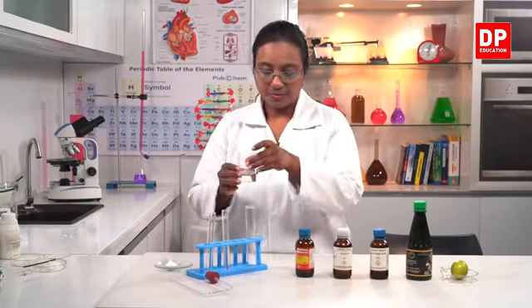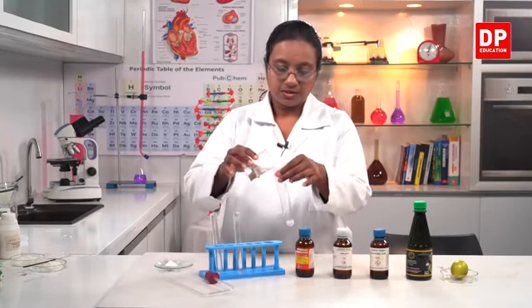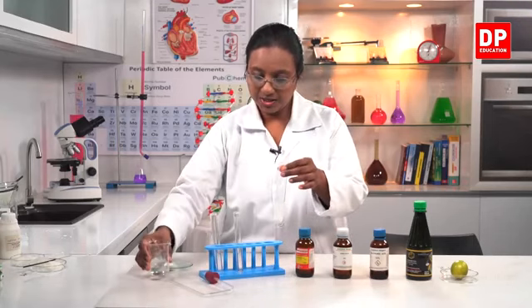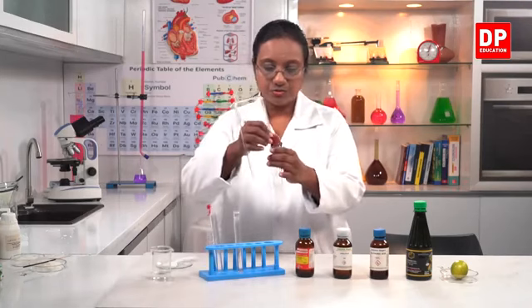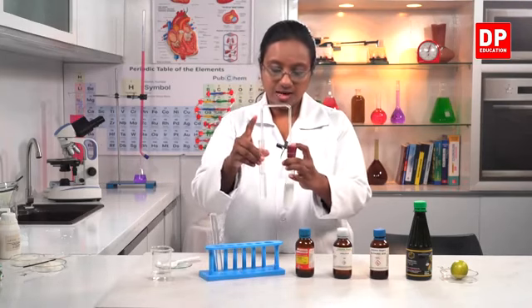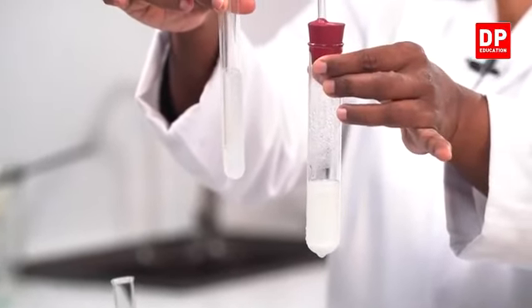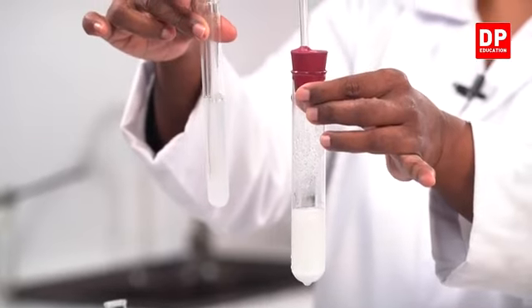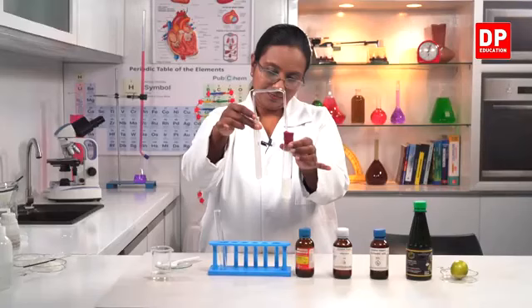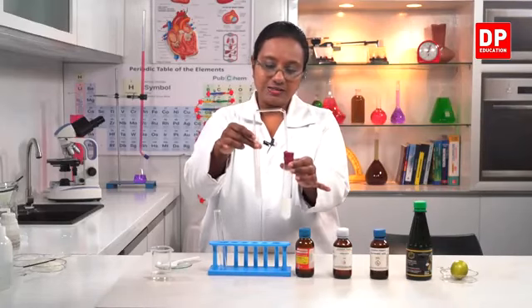To that, I am going to add dilute hydrochloric acid. You can observe the reaction, and then we'll need to close it and transfer the gas into the lime water. So here students, you all can observe the carbon dioxide getting bubbled into the lime water, and you can observe the color change as well. Can you all see the solution turning milky in color?